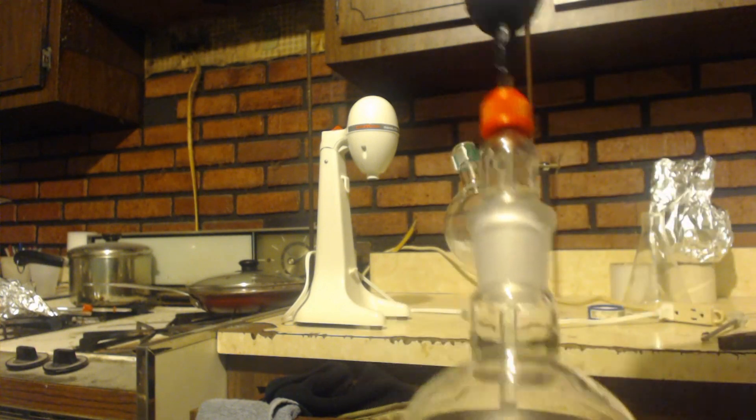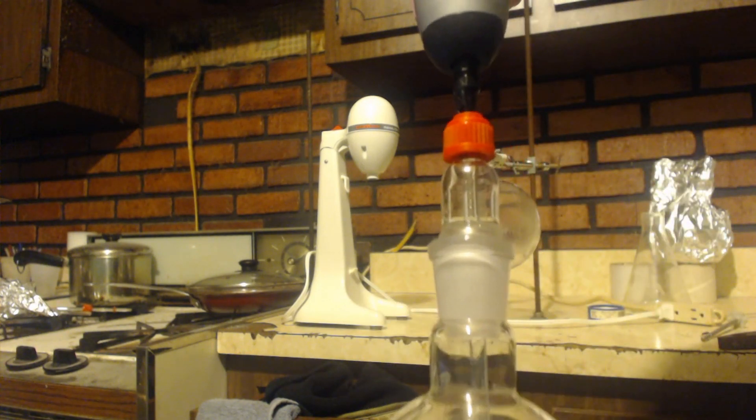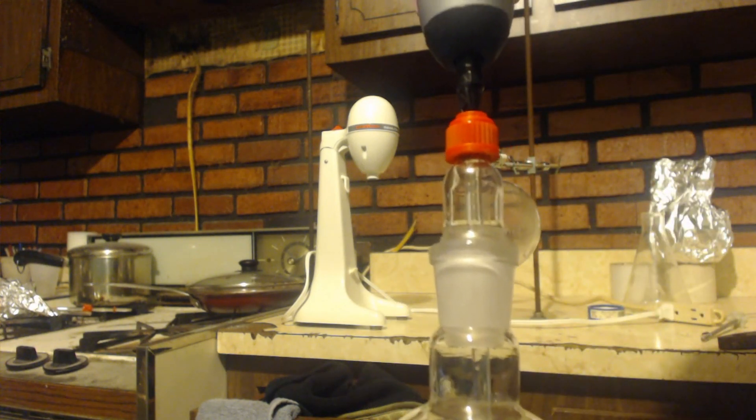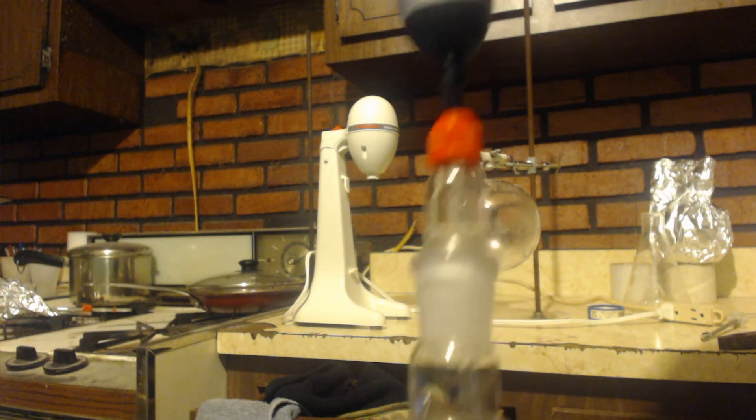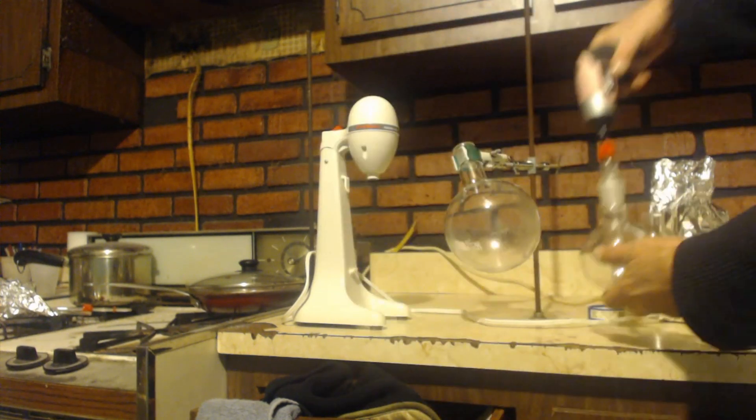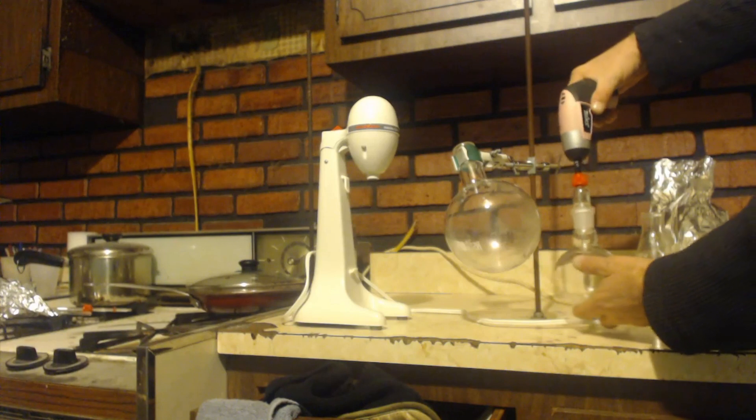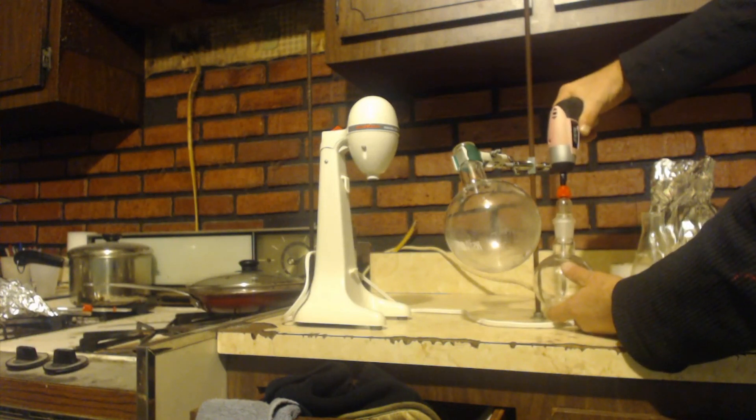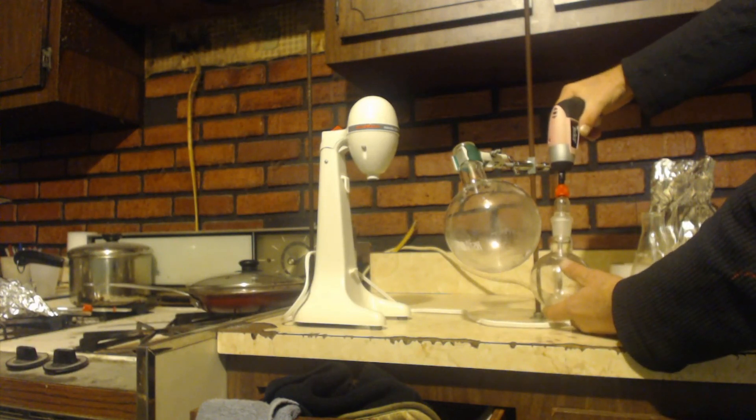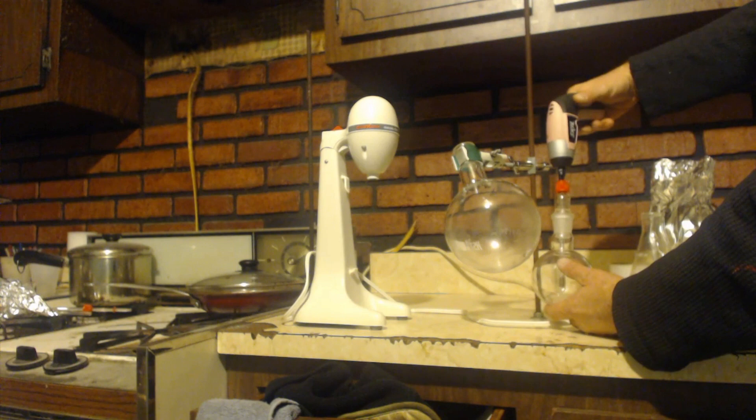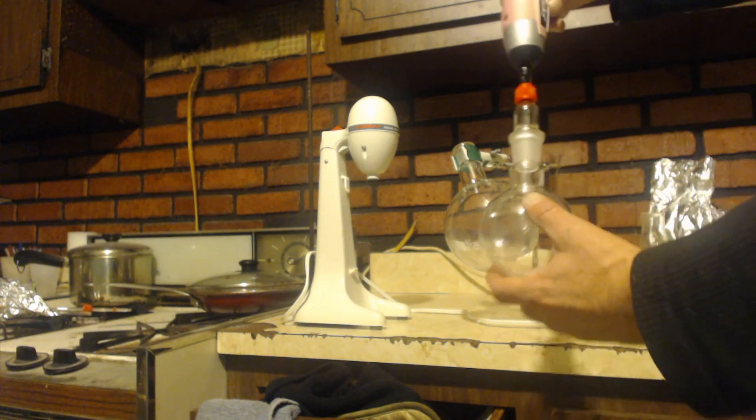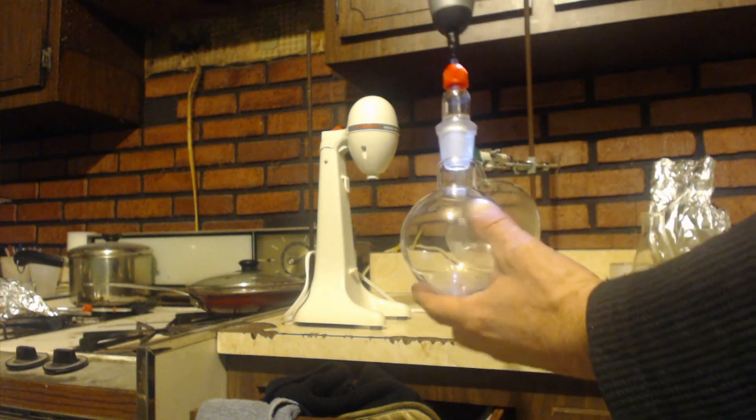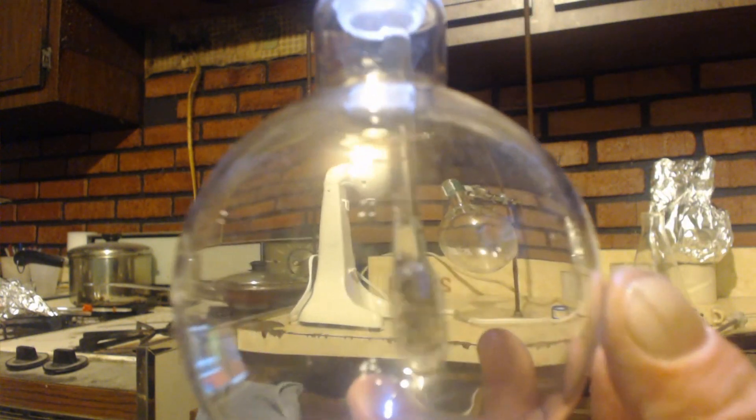You can clamp this on to here so that you don't have to hold it, and put a twist tie around the handle so that it just runs constantly, and then you have that right there.